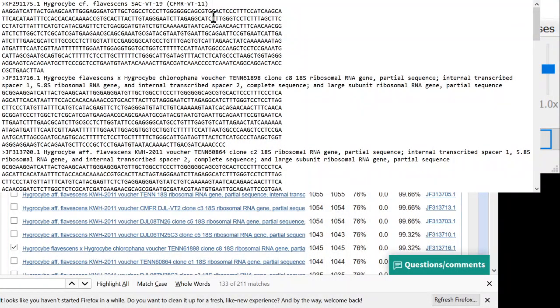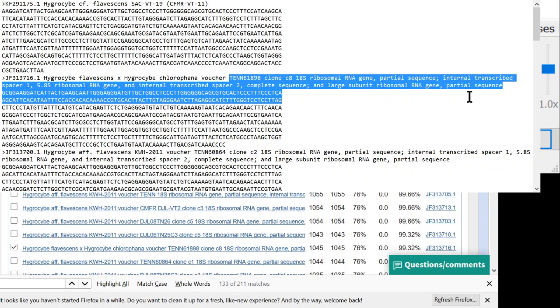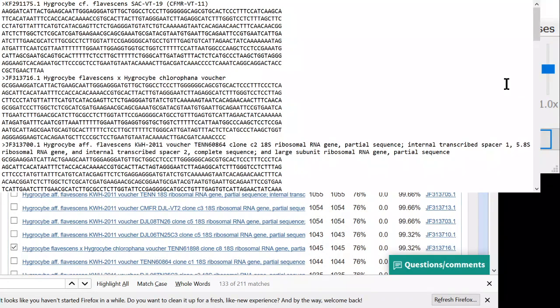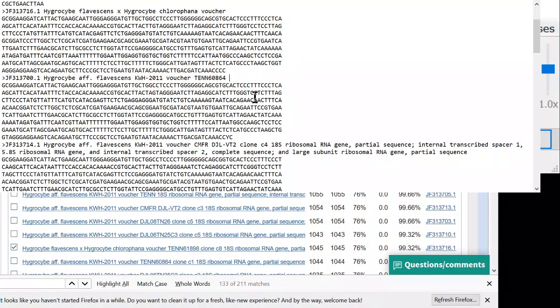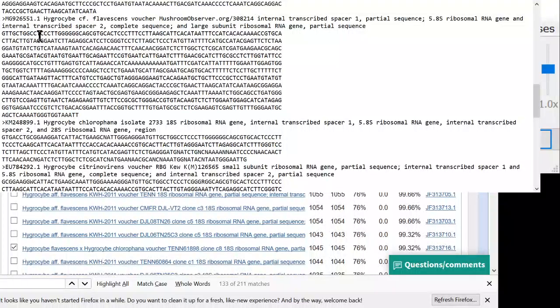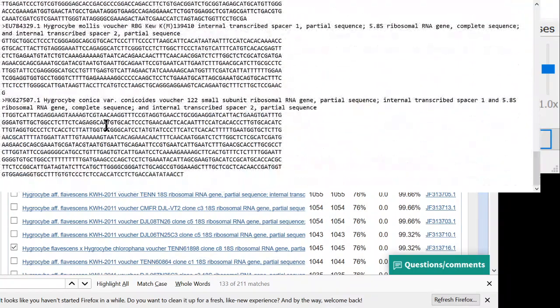And a really cool thing to do here is to put the location. So what I would have to do is look up this accession number and put the location. And when you have locations in your phylogenetic tree, that makes it much more useful. But it's also very time consuming to put in locations, so I will not do it right here. But if I was going to make this tree to upload to Facebook to share with my friends or publish in a scientific paper, I'd definitely put in locations because you get way more information out of it. So you can see we have the greater than sign, the name, the sequence, the greater than sign, the name, the sequence, and that just keeps repeating until the end of the file.